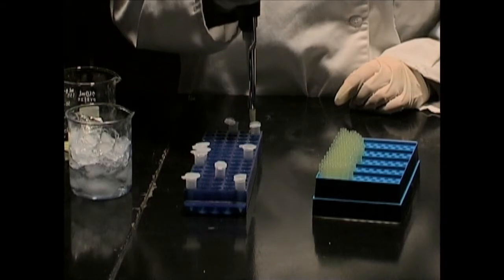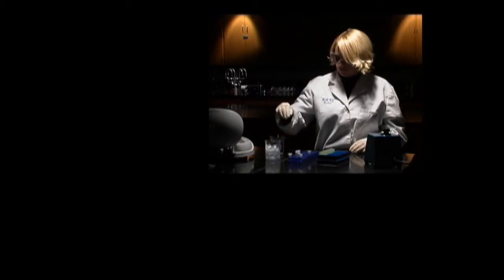Add ice cold ethanol or isopropanol, mix thoroughly, and place it on ice for 5 minutes. The plasmid will now start to precipitate.